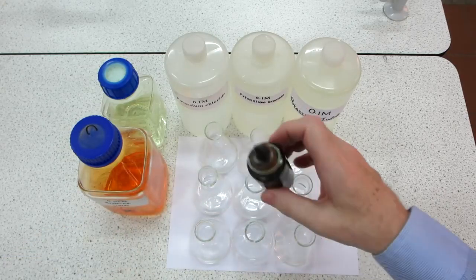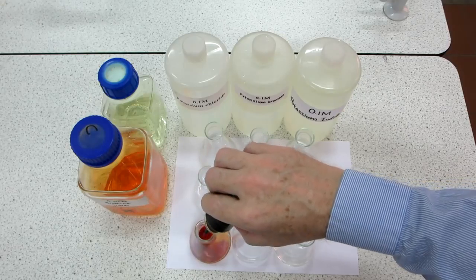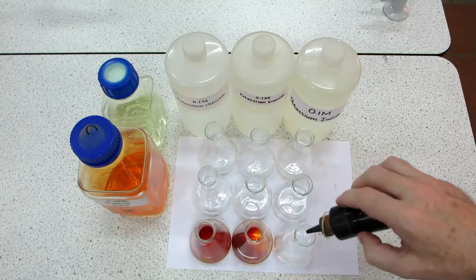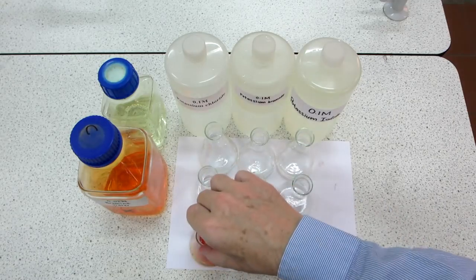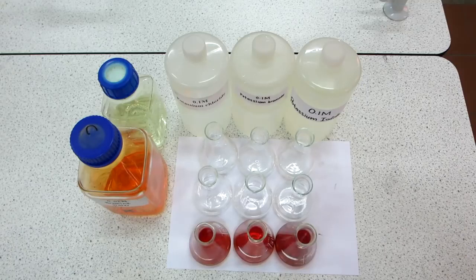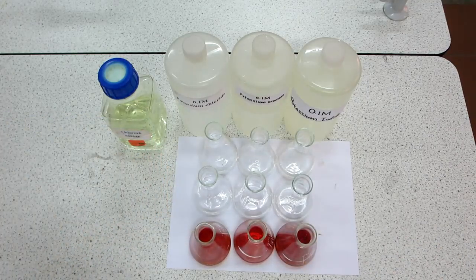Here's the iodine. You can see it stain the bottle a deep brown colour. We're familiar with iodine, and if we place an approximately equal amount, a few mils, into each of those solutions, we see not much difference in the three. Same colour for the iodine, and nothing appears to have happened. Into the second sequence of flasks we're going to put bromine water.